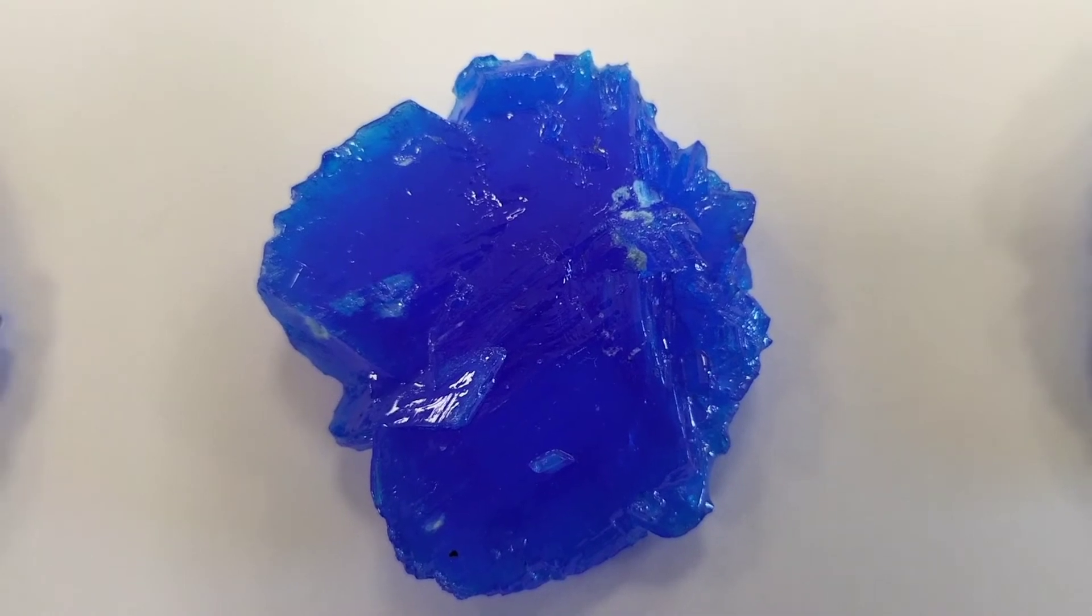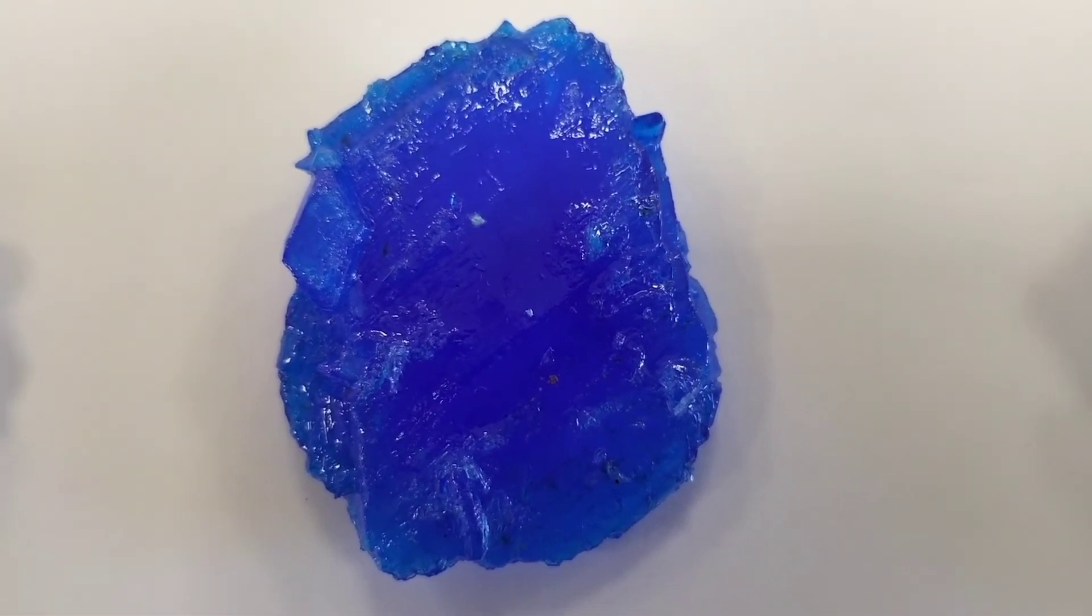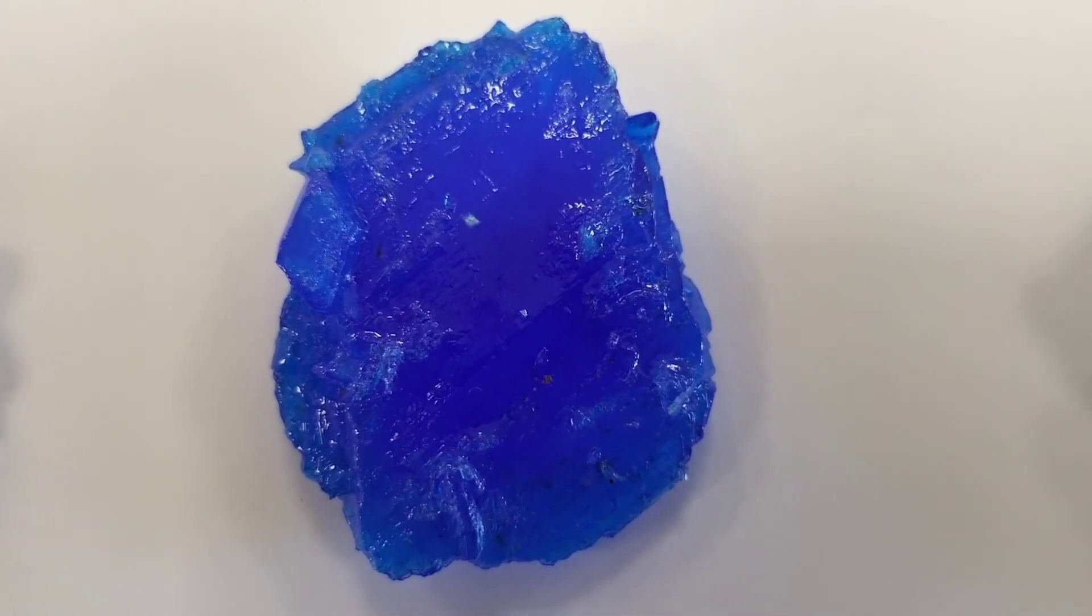Now the pièce de résistance, the slightly larger crystal we were growing. Number four is here and that is a really quite substantial crystal.